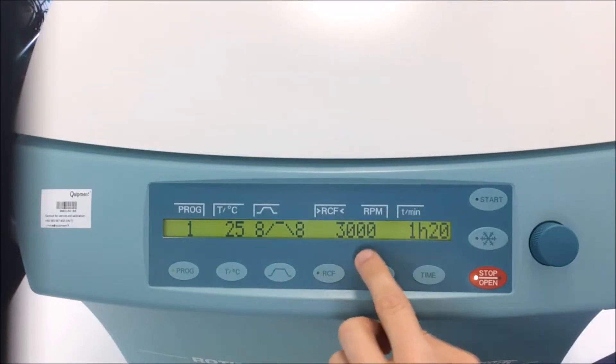The speed is in RPM, rotation per minute, and it's configured to 3000 rotations.